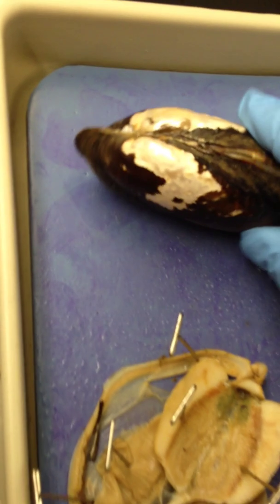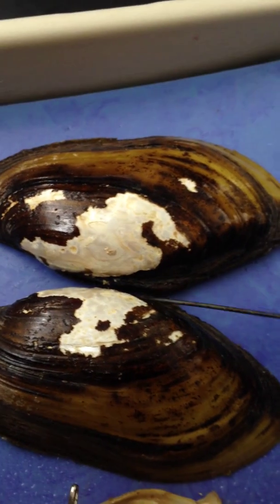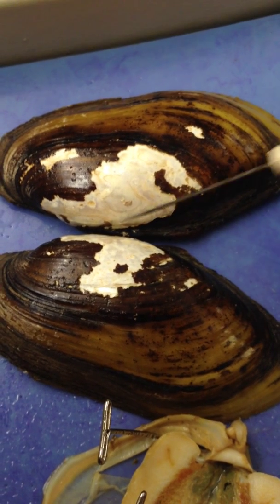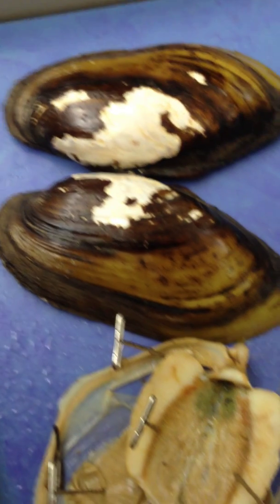This little piece right where the two shell pieces stick together is the umbo, held together by the hinge ligament. The end of the shell that is closer to the umbo should be anterior, but sometimes the pictures lie. That makes this posterior.